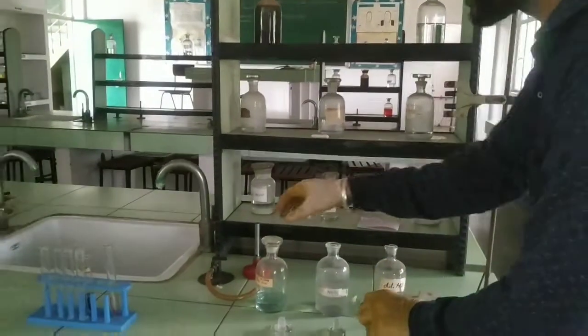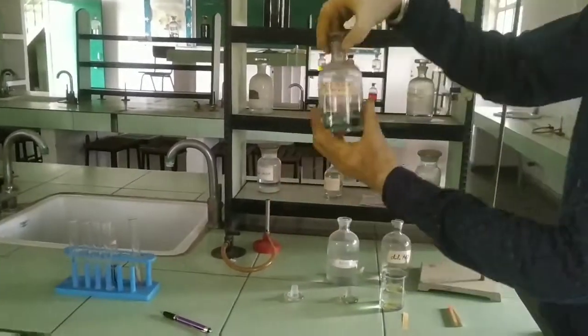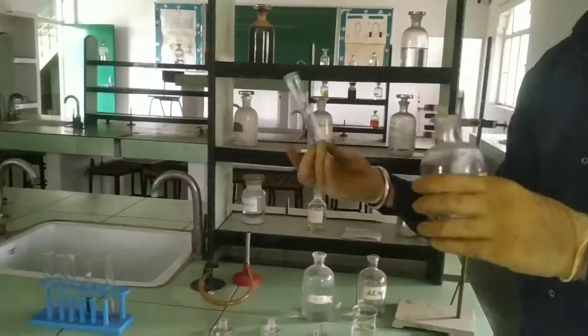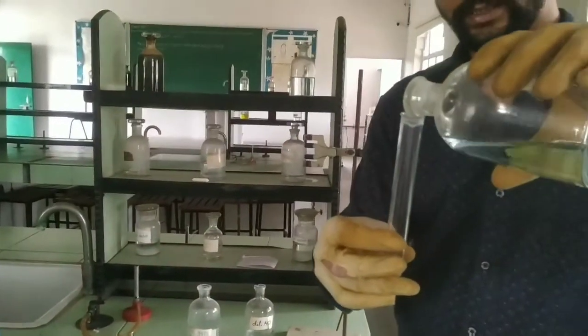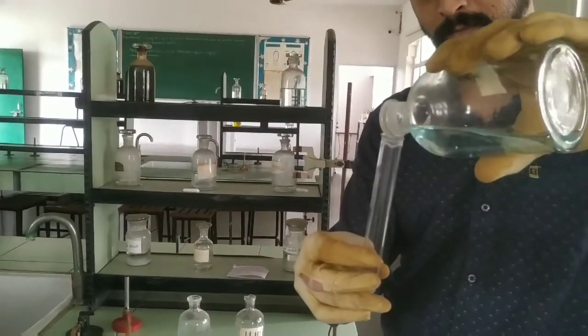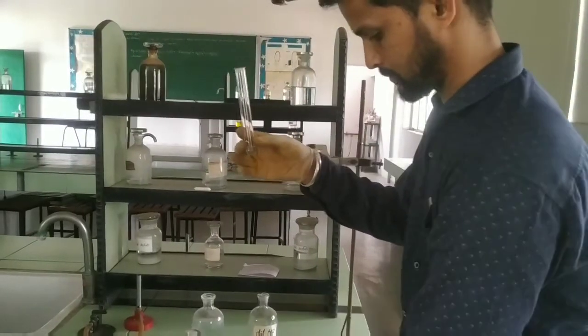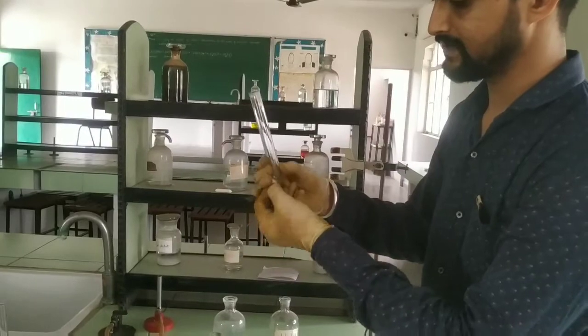Here we have our last sample, that is acetic acid. Same way, we have to take a test tube and add some drops of acetic acid.